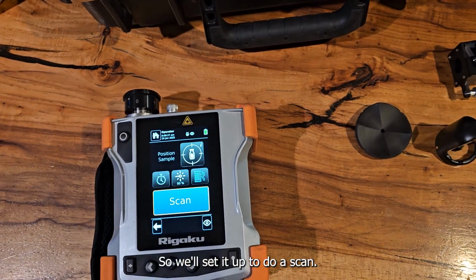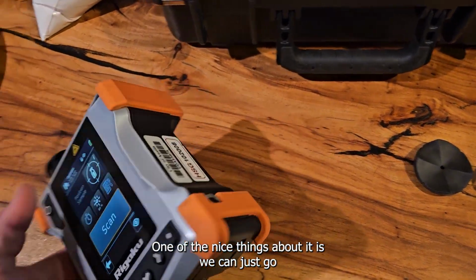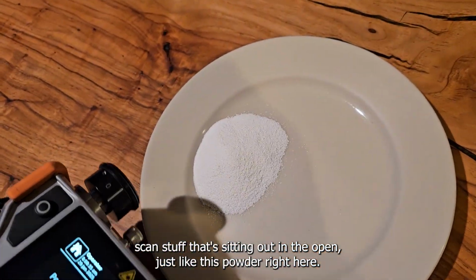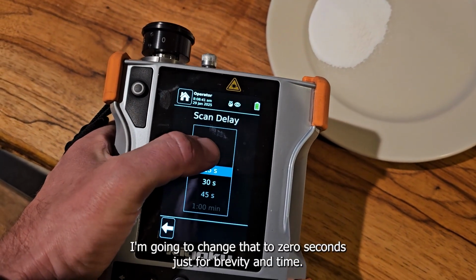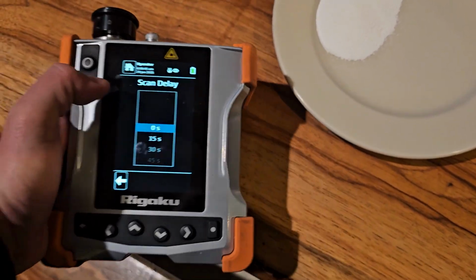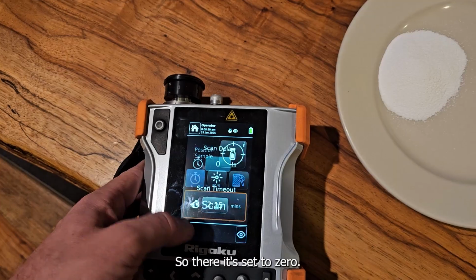So we'll set it up to do a scan. There are several different ways we can scan with this thing. One of the nice things about it is we can just scan stuff that's sitting out in the open, just like this powder right here. So I'm going to change some settings on here that are default. It has a default scan delay. I'm going to change that to 0 seconds just for brevity and time. Sometimes it doesn't like your input on the finger. So there, it's set to 0.